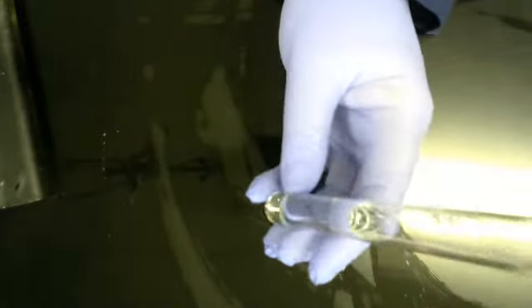Now, what about a large spill? Large spills require much more intense mitigation. A large spill is defined as anything more than 10 milliliters. Now, in here I estimate I probably have around 11 or 12 milliliters. This is water, by the way. It's mostly as a demo. Look at how much more liquid there is.